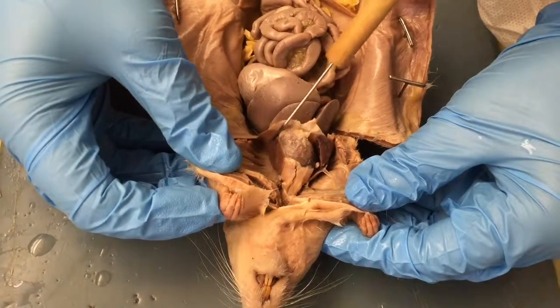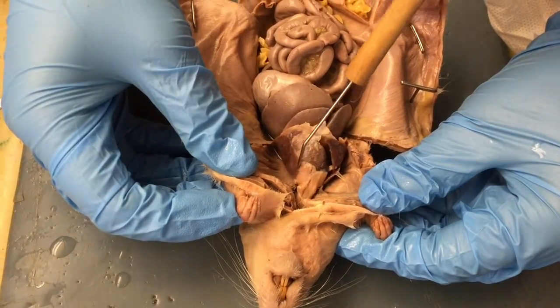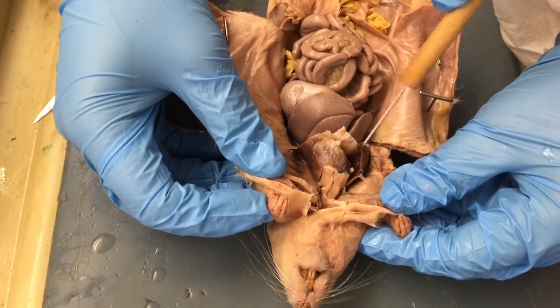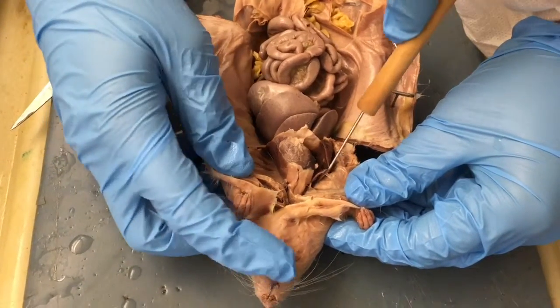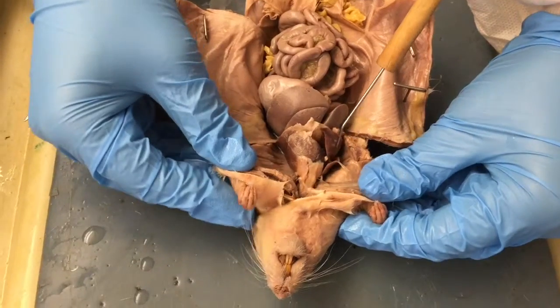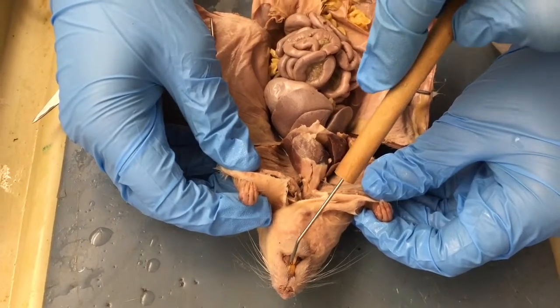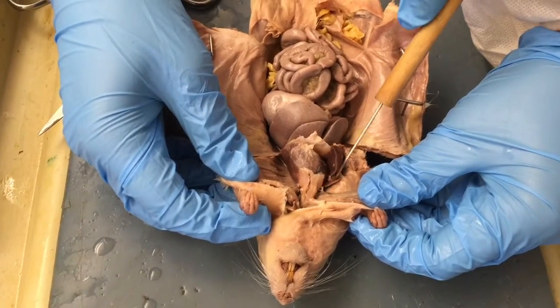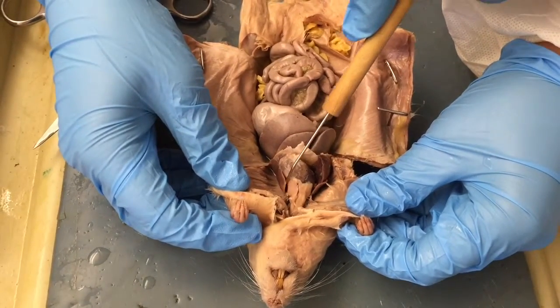The respiratory system is a series of organs responsible for taking in oxygen and expelling carbon dioxide. The lungs, nostrils, pharynx, trachea, and bronchi are what make up the system. The respiratory system and the circulatory system work together by putting oxygen into the blood to be distributed.